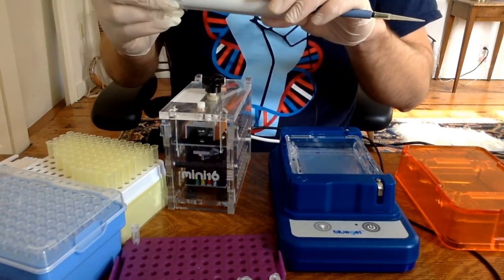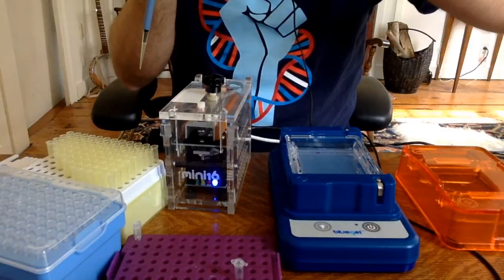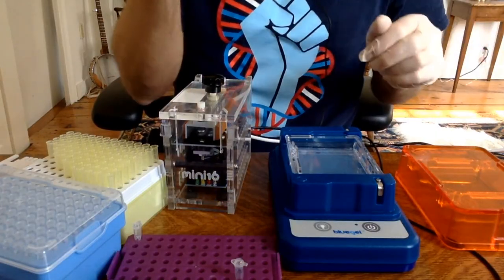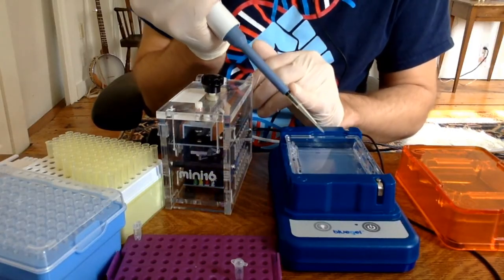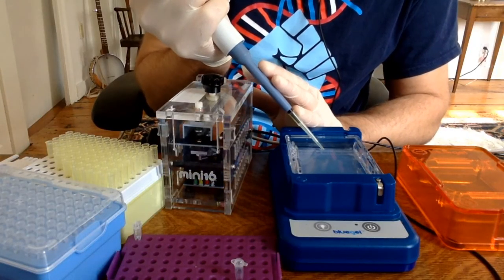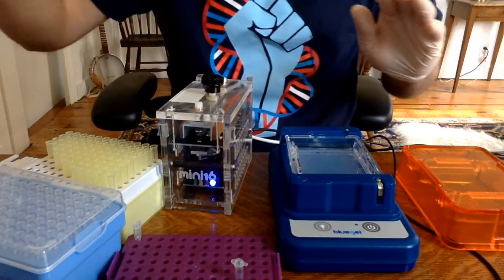I'm now going to put in 12 microliters of my other samples. So these ones I have prepared. They're both of my DNA, and one I haven't restricted. Put this one in first. And just to load a gel, you have these little wells there, but the DNA that we're putting in there has a dye in it, and that dye is heavier than the buffer, so it sinks down to the bottom. So you can just keep your tip sort of above the well, and you just slowly release. I use my other hand to steady.